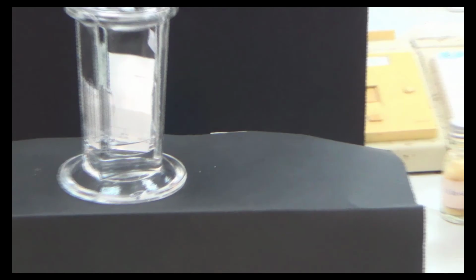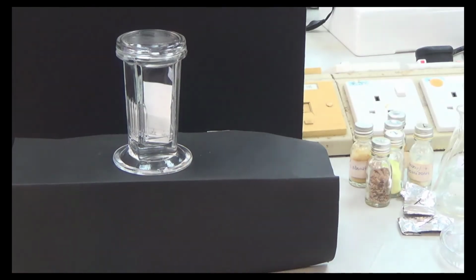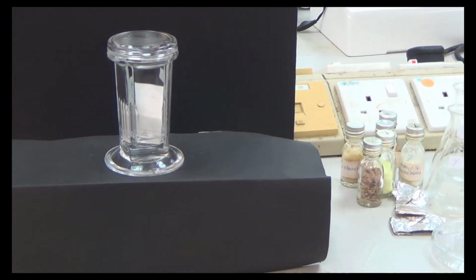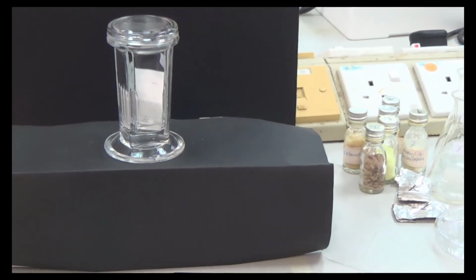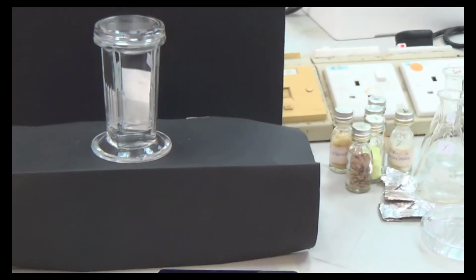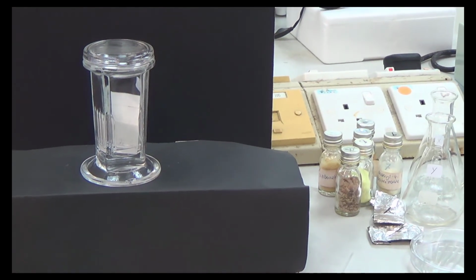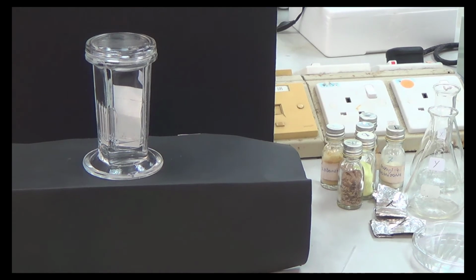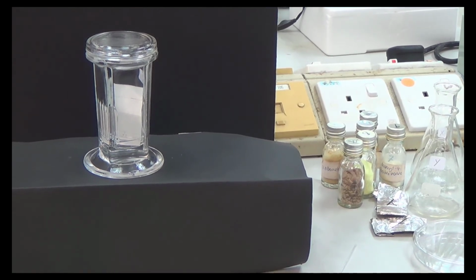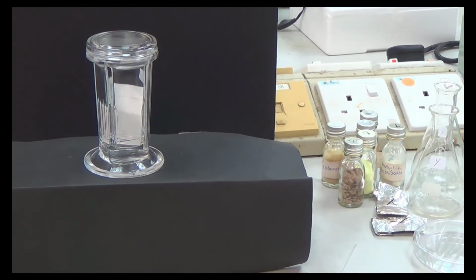I think you can see now the thing going up. So you need to stop, you need to pull it up. Wait, I need to adjust my camcorder. You need to pull it up once the solvent reaches the top. This is why we call the solvent the mobile phase, because it's mobile, it's moving, and while it's moving, it's sort of like kicking the compound on the TLC plate.